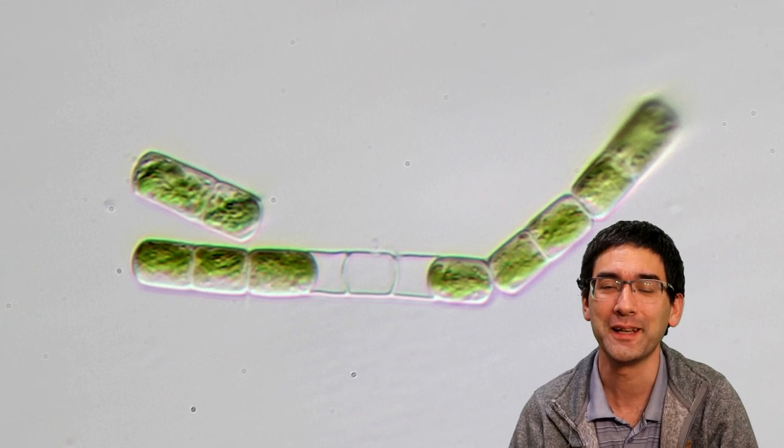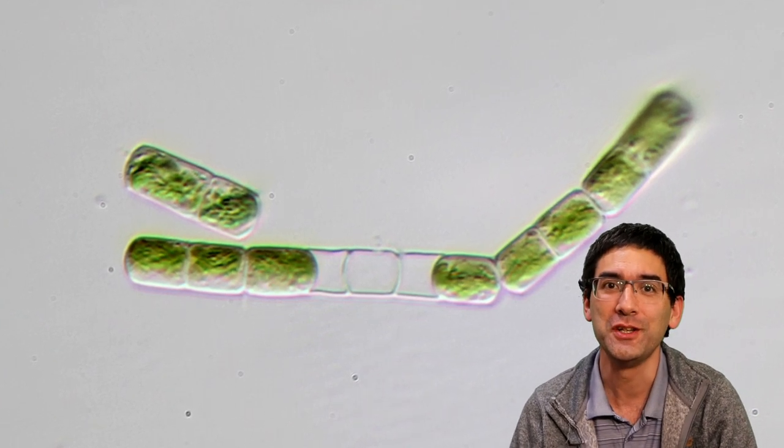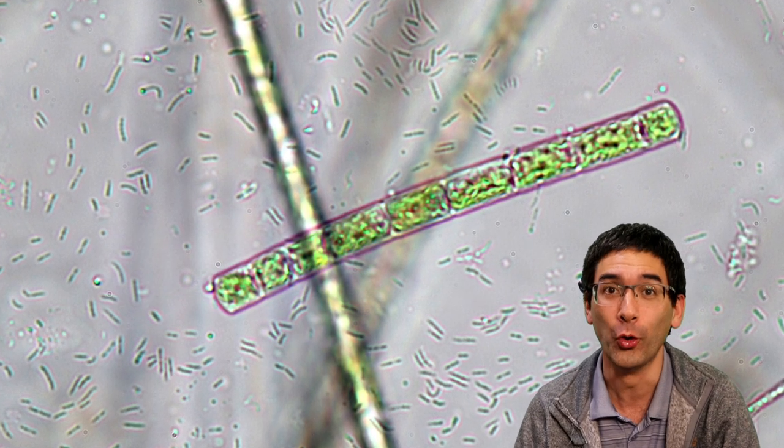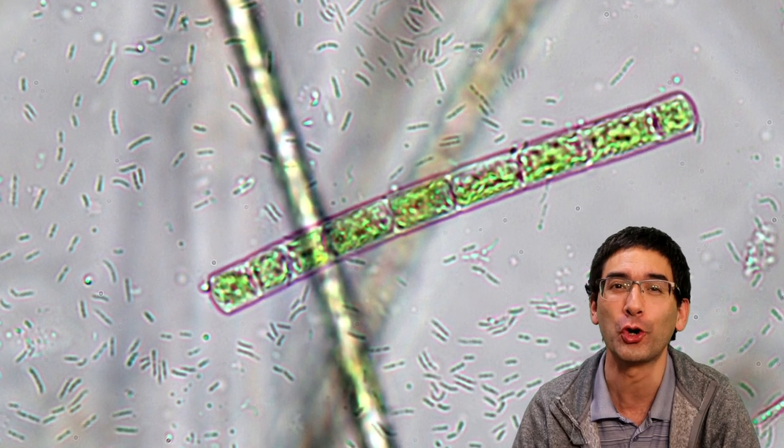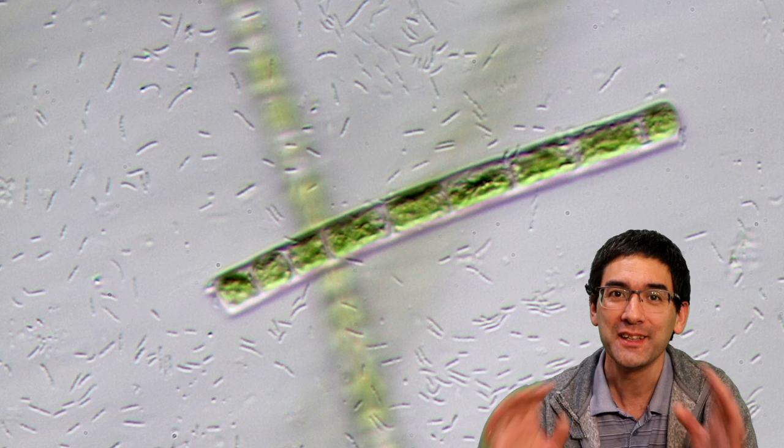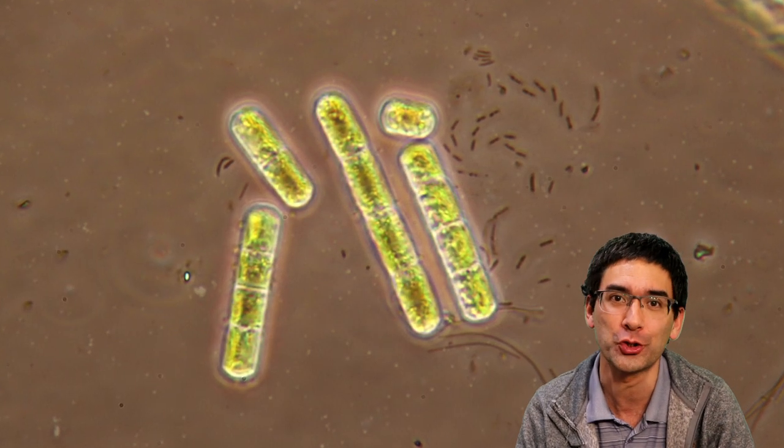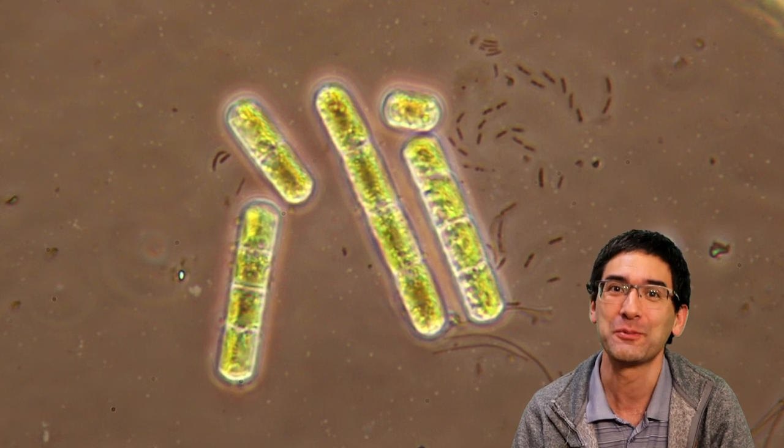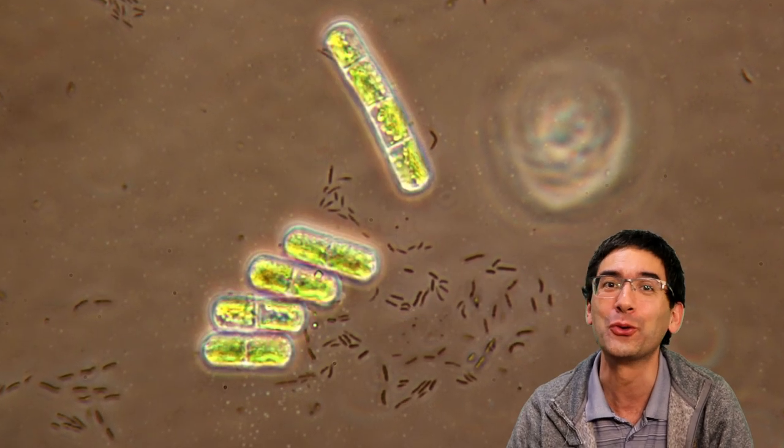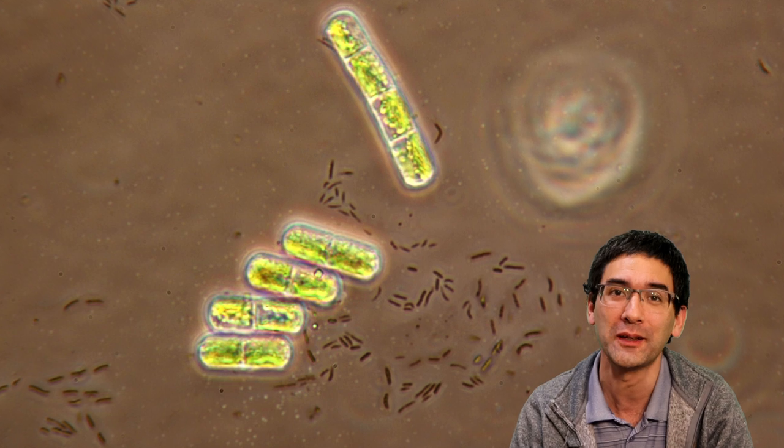Hi, Microbe Hunter here again. These algae that you see here, I grew them at home in small glass jars on my windowsill. In this video I'd like to show you how you can make enrichment cultures like these, because in many cases you probably won't be able to go out very frequently to collect water samples.